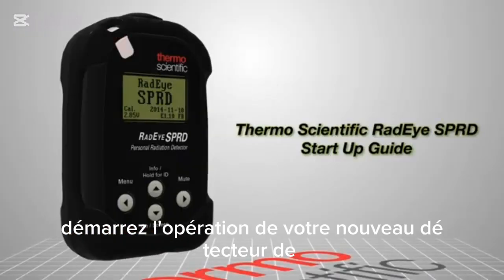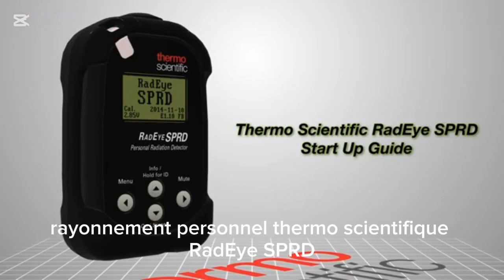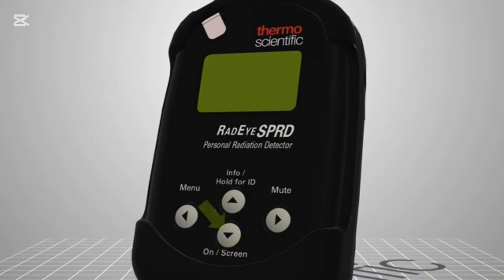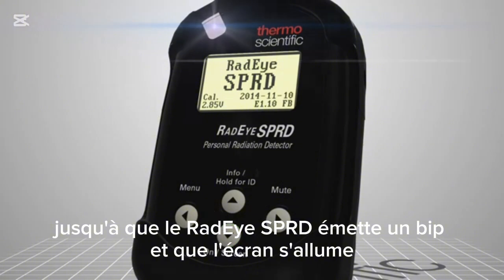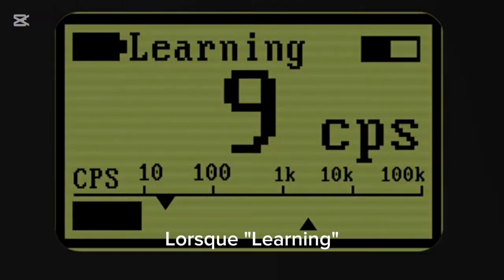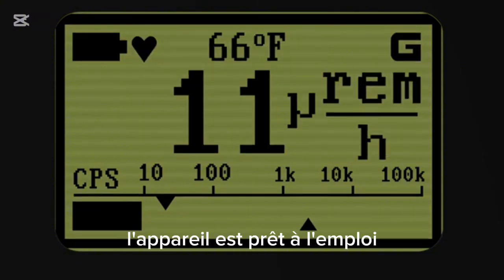Startup and operation of your new Thermo Scientific RadEye SPRD spectroscopic personal radiation detector. To turn on your RadEye SPRD, push and hold the on button until the RadEye SPRD beeps and the screen turns on. The RadEye SPRD will automatically go through a systems check. When "Warming" no longer displays in the top left of the display, the unit is ready for use.